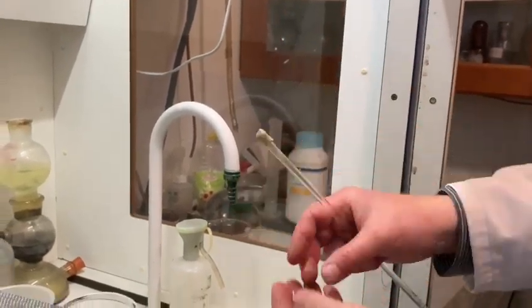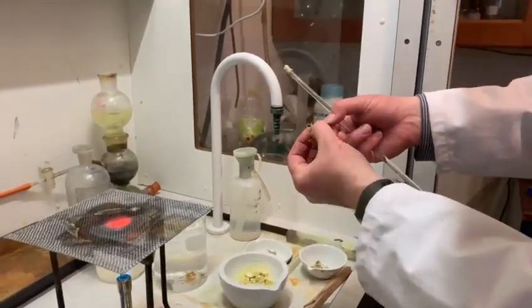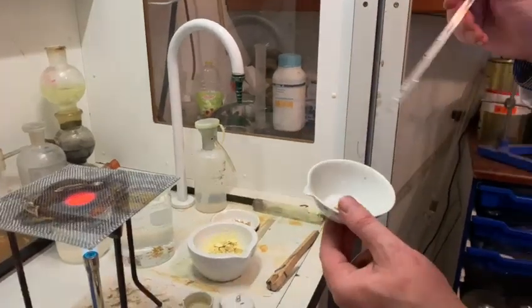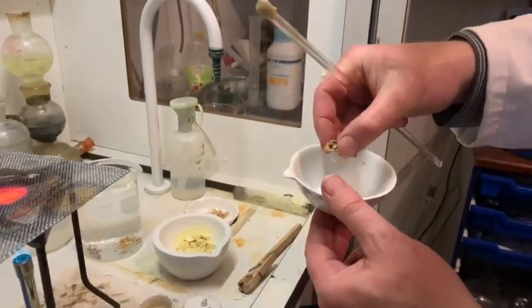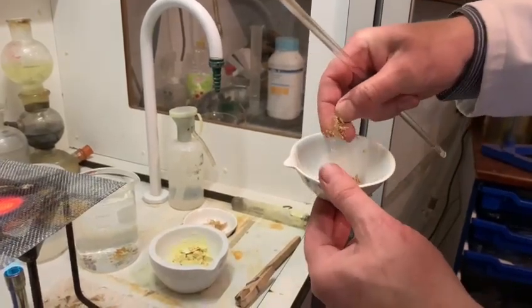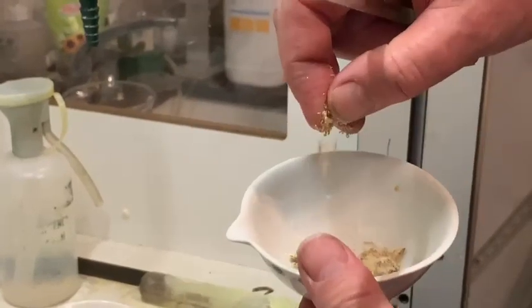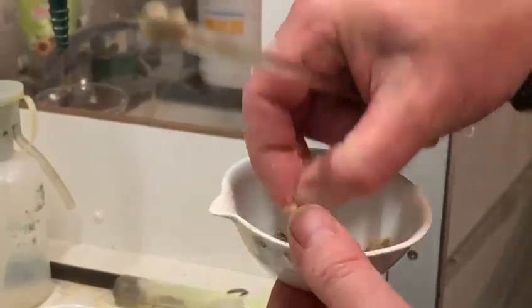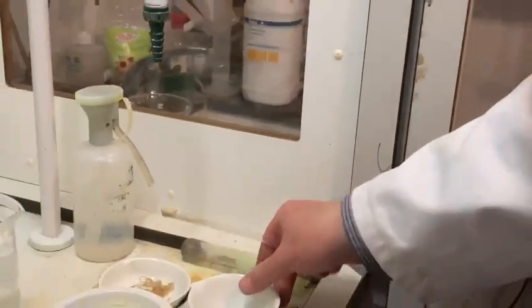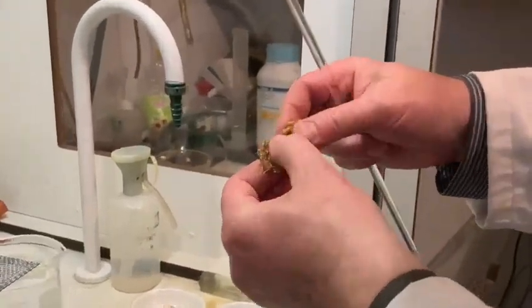Sulfur was melted and used as an insulator in electrical components years ago as a rubber-type substance. A couple of days ago I rehearsed this and left it deliberately out today in the bright sunshine. As you can see, it's changed from a plastic substance into a very brittle substance, because it's changed allotropic form yet again — same chemical properties but very different physical properties from this spongy rubbery plastic sulfur.